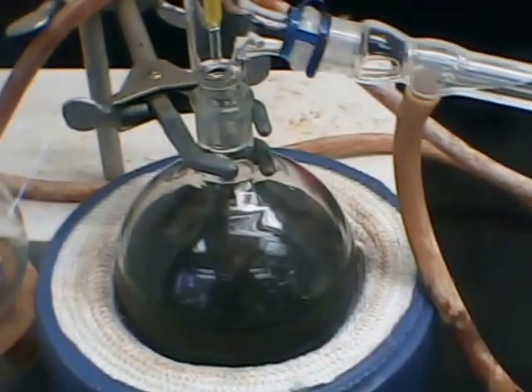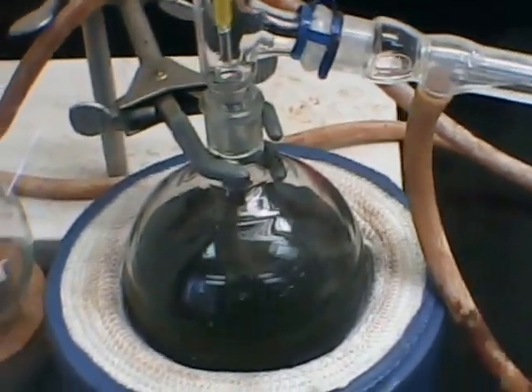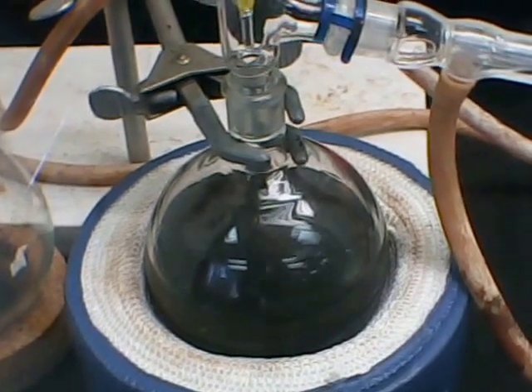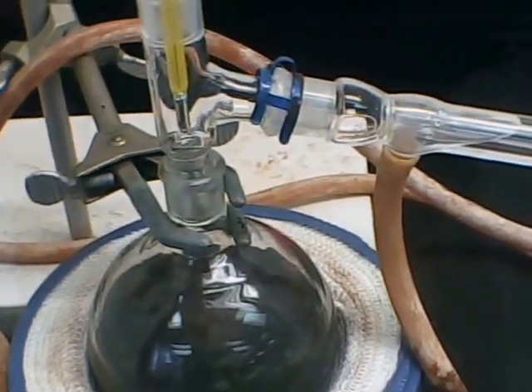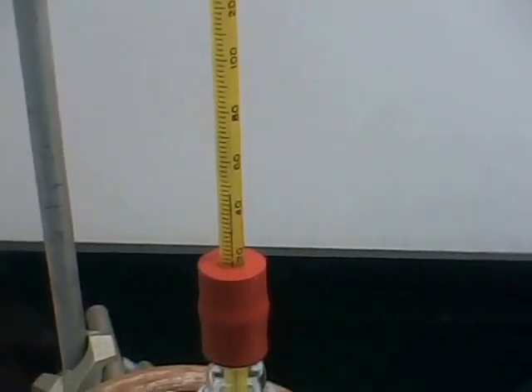And I was curious what range I'll get on this. Now of course there's butanes, volatile butanes. But I started to get condensable distillate at about 40 degrees Celsius.